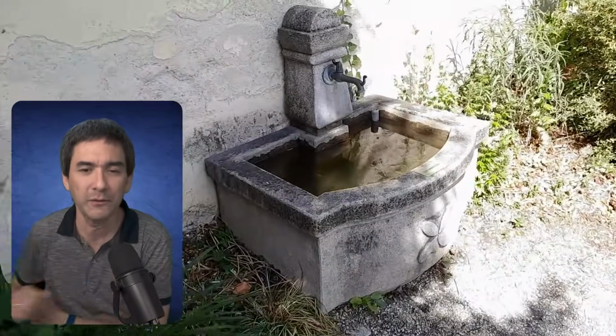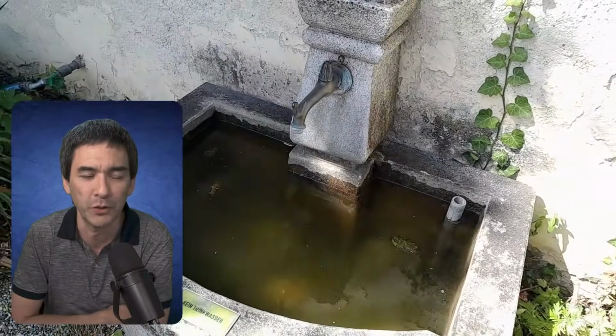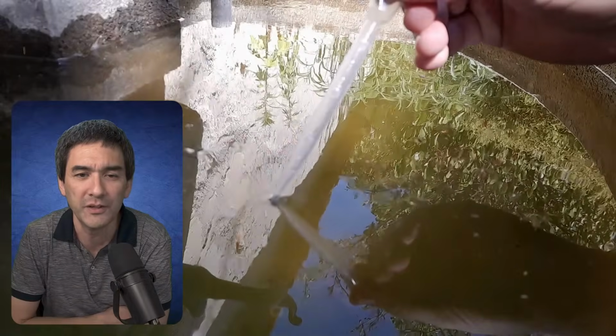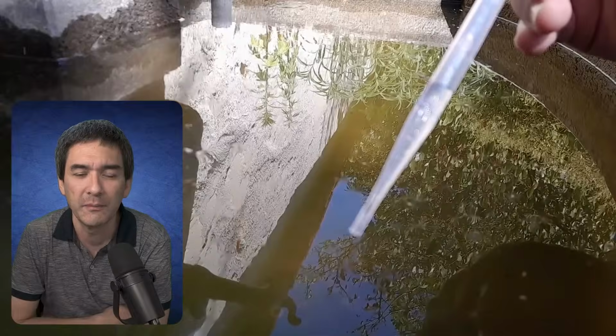This was in a flower garden, and they've got this little water fountain over here. It's not potable water, and they're using this to water the flowers. And that's the flower garden. It was very dry the last couple of weeks, like in many places of Europe, so it's not quite as green and lush as it used to be. But there was plenty of water in here. And what I've done was, with a pipette, I tried to catch some of those larvae, because they were very quick.